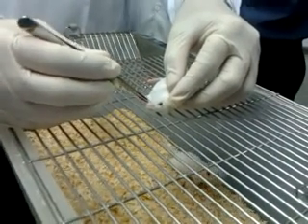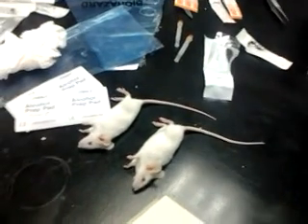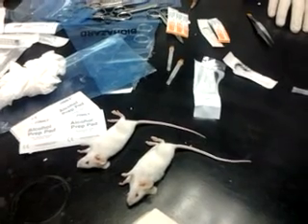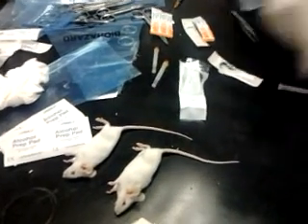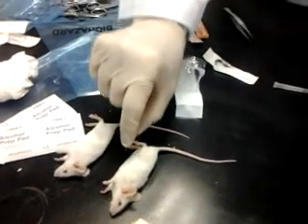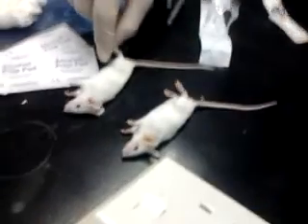Okay, we pull the tongue to the side so that we can breathe. But can we really do orbital sinus bleeding at this stage? You ask yourself, does the animal feel pain? Yes. How does it feel pain? Because when you pinch them, they have a reflex. That means this is not under anesthesia yet. Just only sedative. This is also the same.